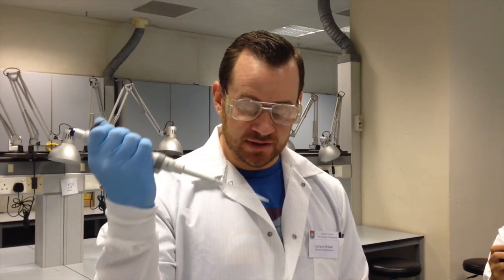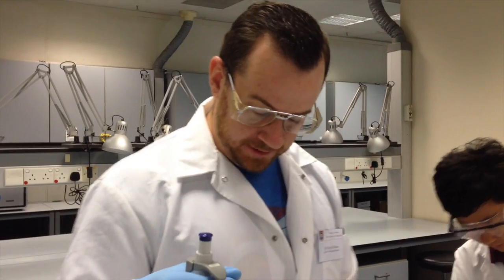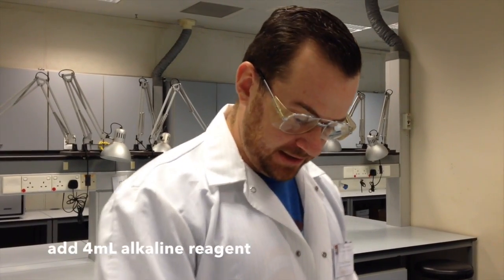Okay, so I've transferred all of my standards into their reaction tubes, and now I need to start to prepare my oxidizing reagent using the alkaline reagent and the sodium hypochlorite, which is simply household bleach. I'm going to use the tube that's supplied for me, labeled oxidizing reagent. I'm going to open it up, and using a new pipette tip, I'm going to obtain 4 milliliters of the alkaline reagent.